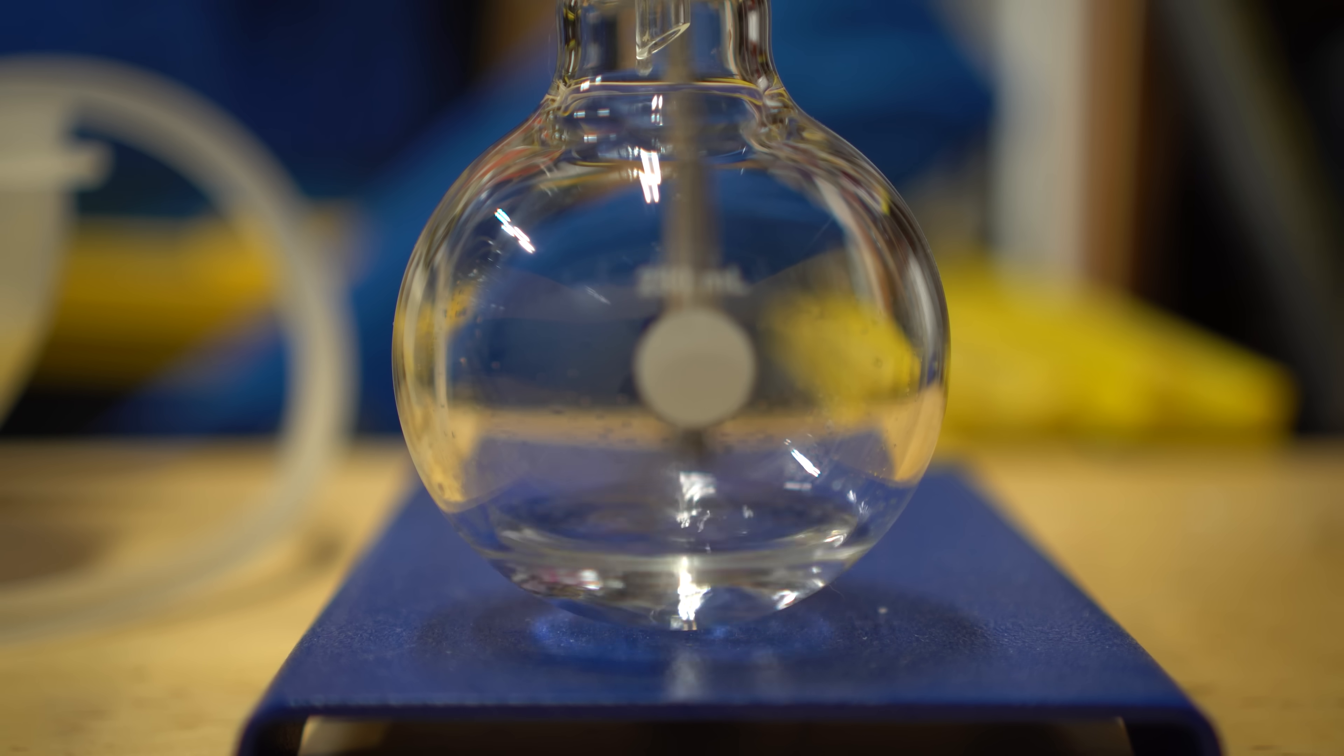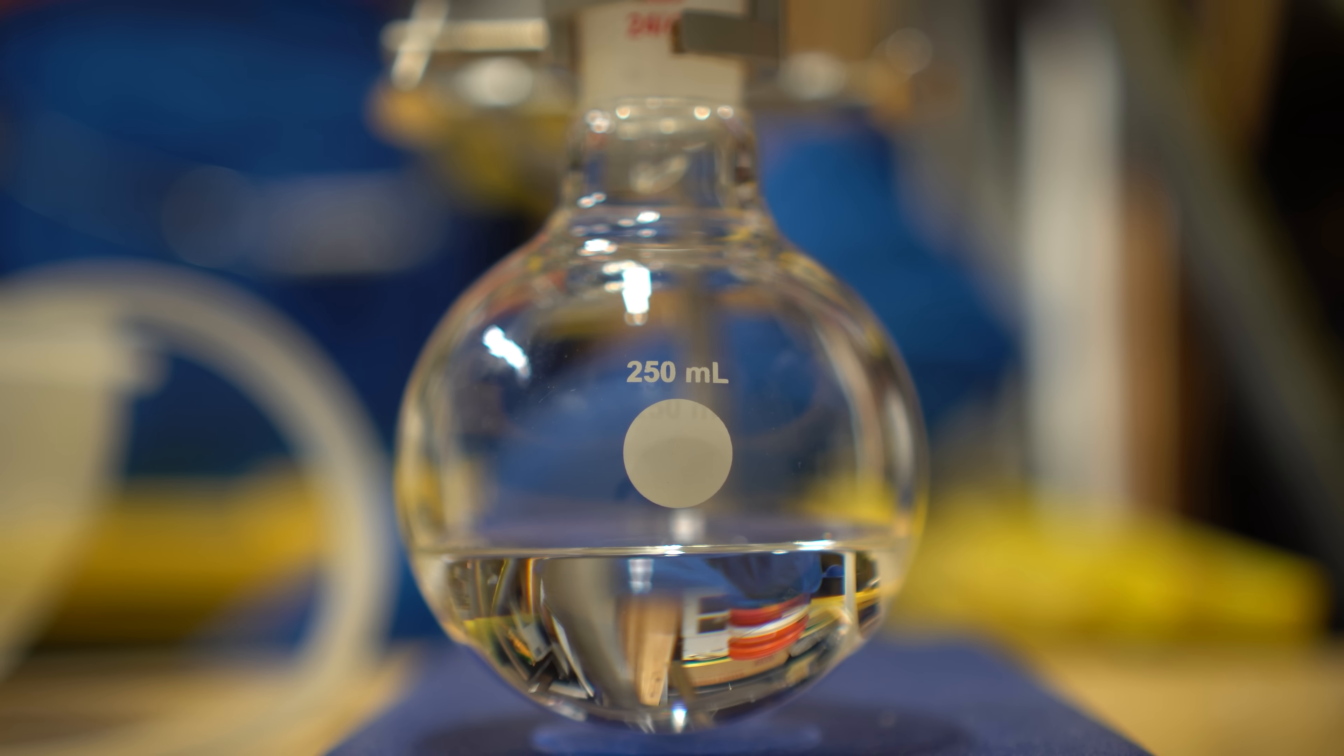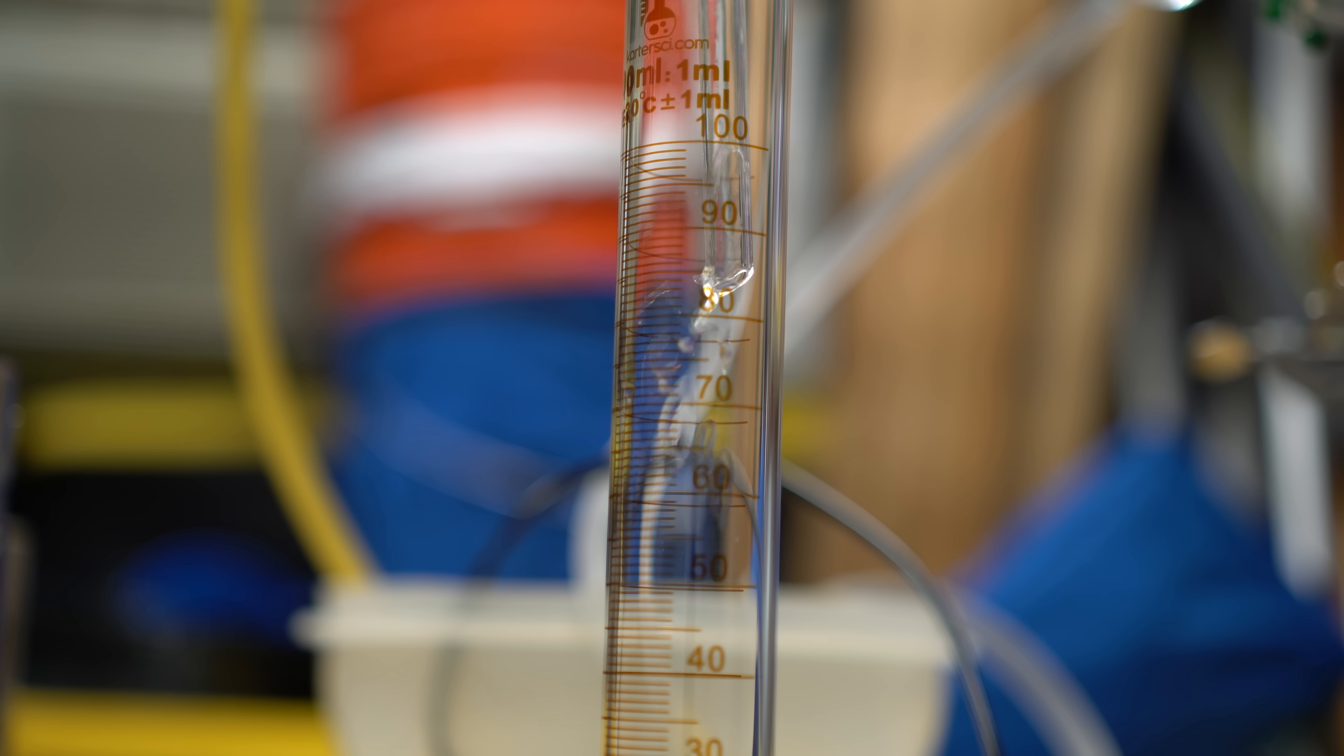After discarding the first portion, we can see that the liquid is now clear and relatively pure chloroform. Here is the final amount of chloroform that we got, and it's actually really cool when you look into the liquid, it has a really weird refraction that's different compared to water.